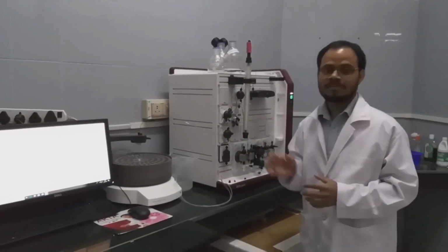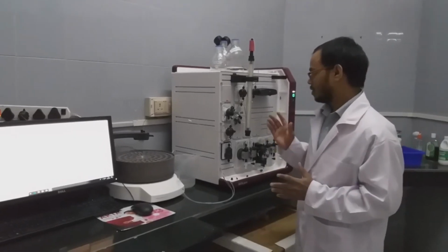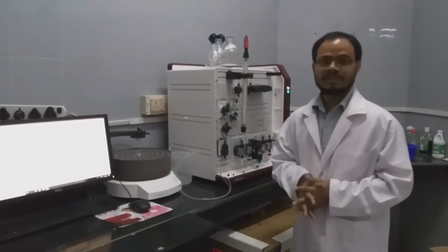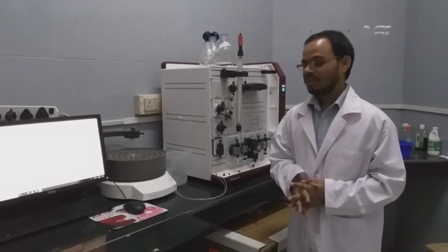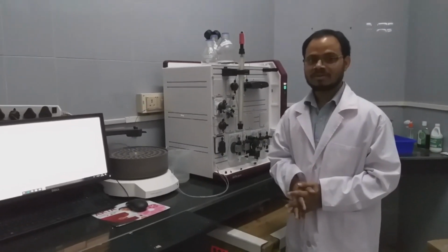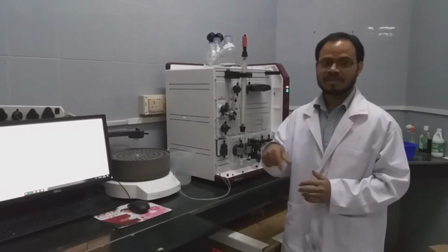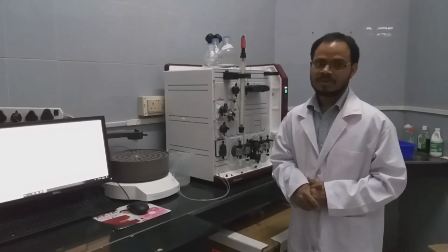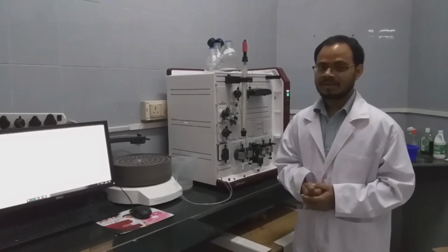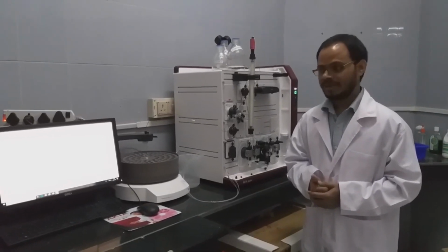So this is the gel filtration column attached to the protein purification system. Here we will inject blue dextran and BSA and show their pattern, how they elute. Blue dextran gives the void volume of the column, and BSA gives an actual elution pattern. If you run a few more proteins with known molecular weight, we will get the calibration curve. With that we can calculate an unknown protein's molecular weight.